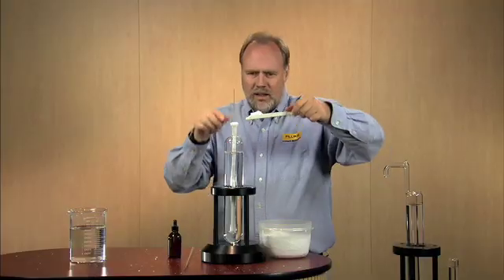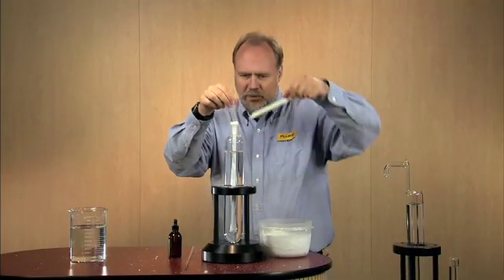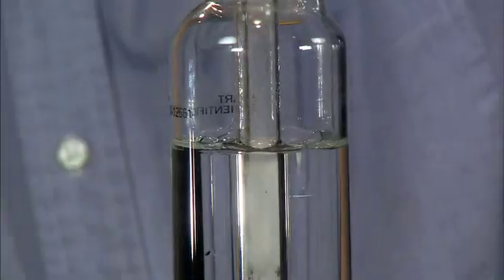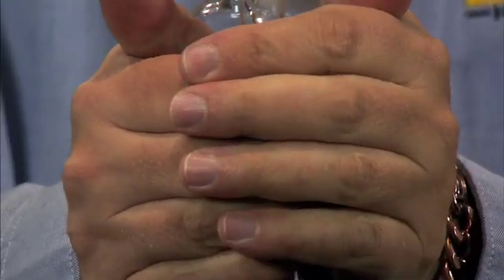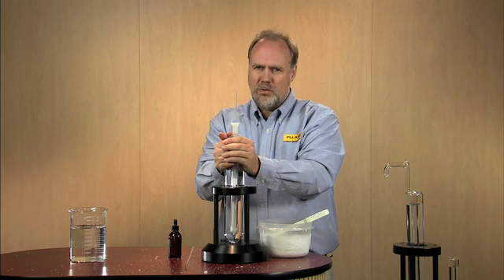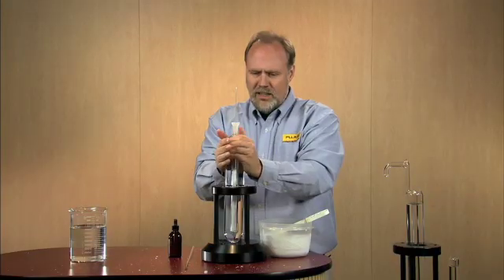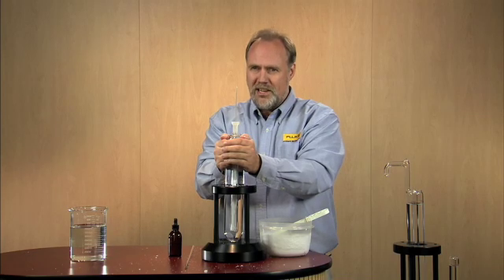Now, I'm starting to see forming what's called an ice bridge, but that means I've got solid ice freezing from the well right to the outsides. When that begins to happen, you need to warm it up and melt it away. If you let it go unchecked, it will break your cell.